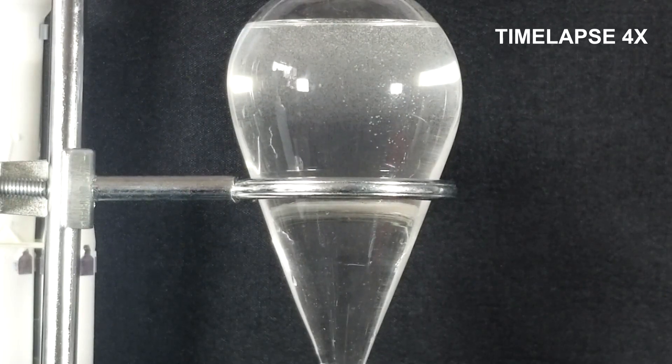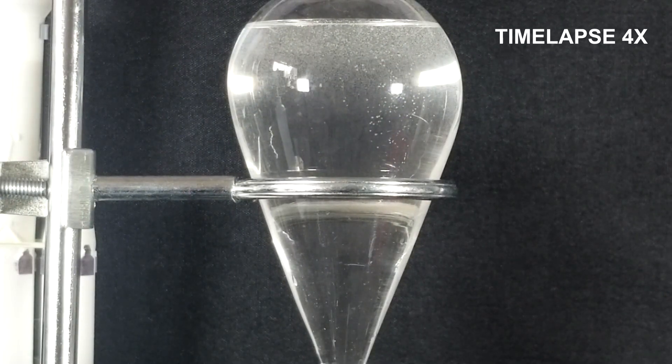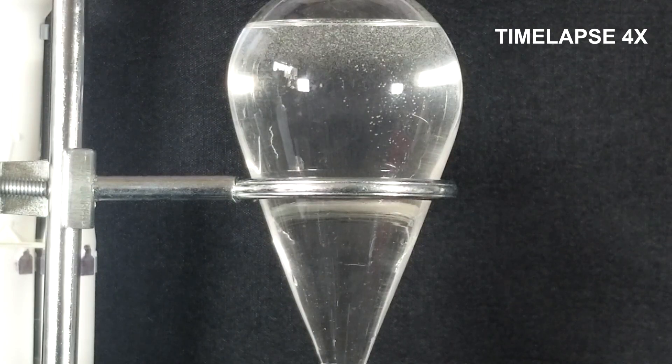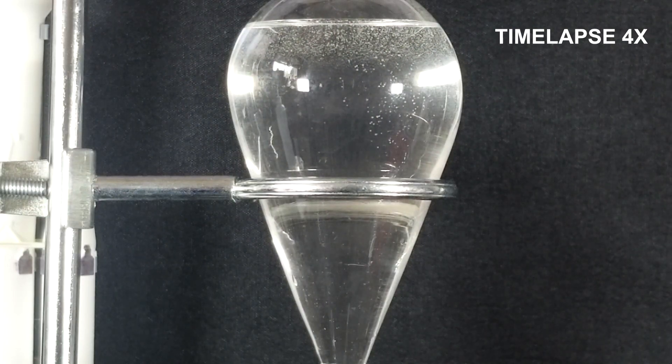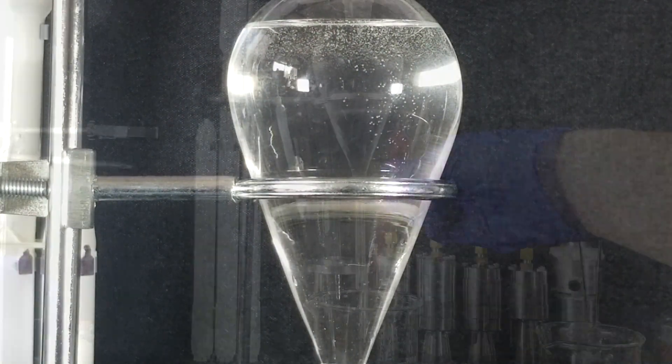After letting it sit for a while, you can see all the white particles are floating on top. I couldn't determine if this was just the essential oil particle or something else. Please let me know in the comments section.